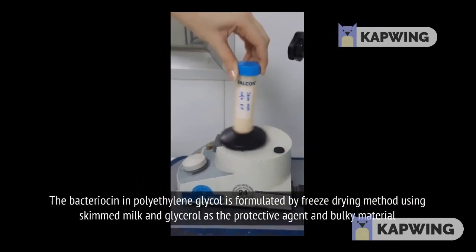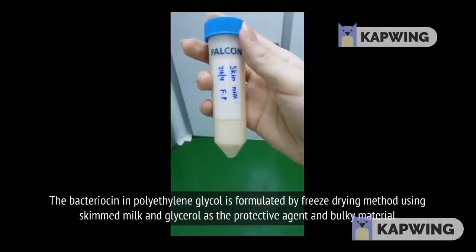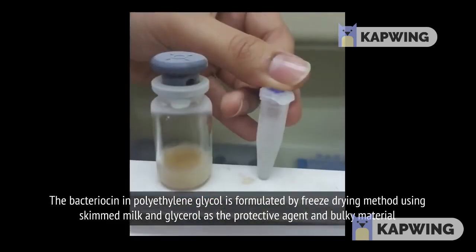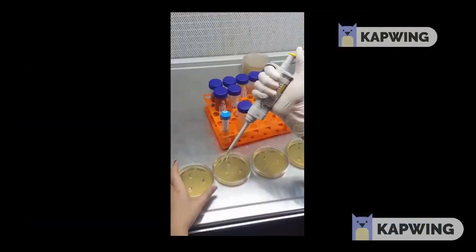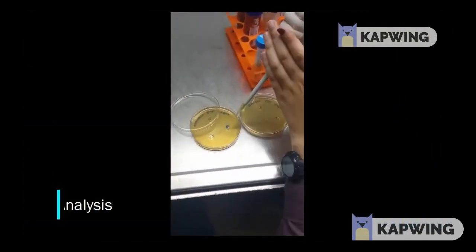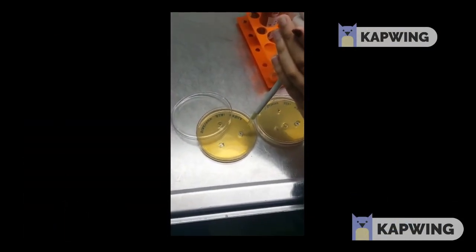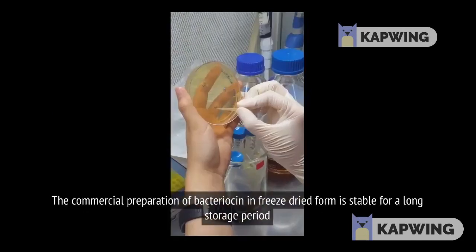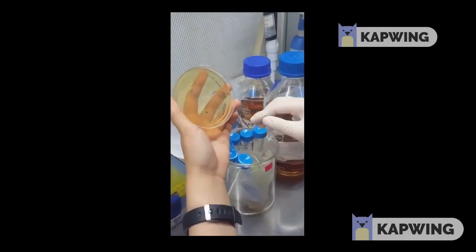The bacteriocin in polyethylene glycol is formulated by freeze-drying method using skim milk and glycerol as protective agents and bulking materials. The bacteriocin activity is analyzed against food pathogens such as Listeria. The commercial preparation of bacteriocin in freeze-dried form is stable for a long storage period.